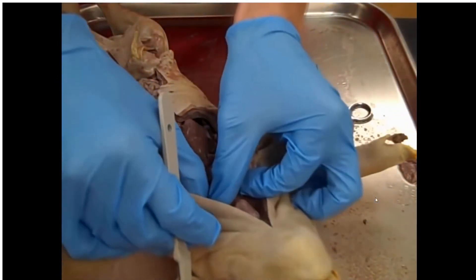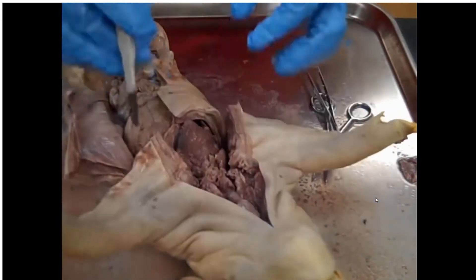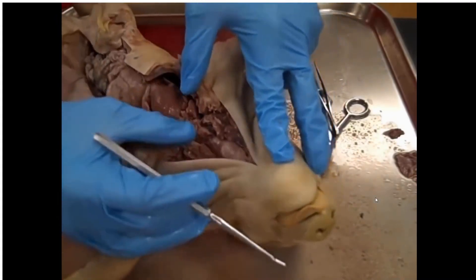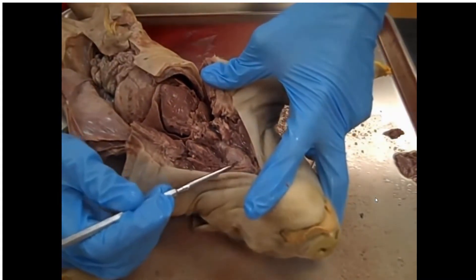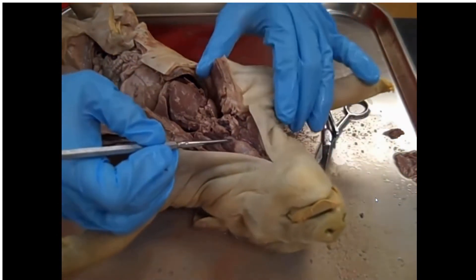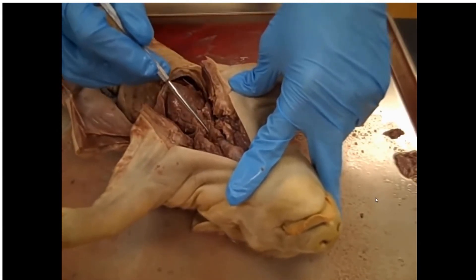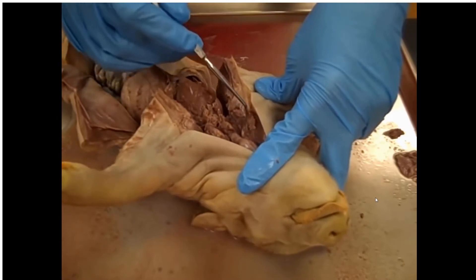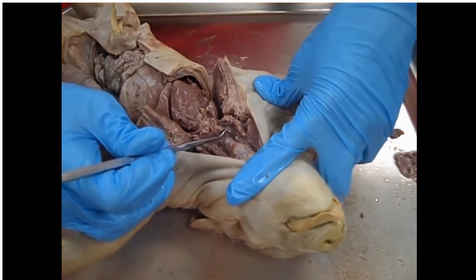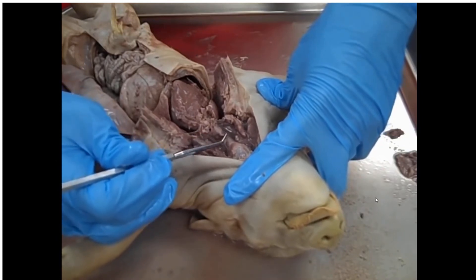All right, I believe we're just about there — least enough so that I can run through some structures with you. Let's start up here with the neck. Right up here is the larynx — you can notice it's enlarged and cartilaginous. Below it we have the trachea, or the windpipe, and you can notice that there are rings of cartilage running all the way down the trachea, just like with a human. Now, unlike a human, the thymus glands of the pig lie up here in the neck. That fleshy lobe right here — each of these is primarily thymus. Right here in the middle of the trachea is the thyroid gland, found in a very similar position as you would see in human anatomy.